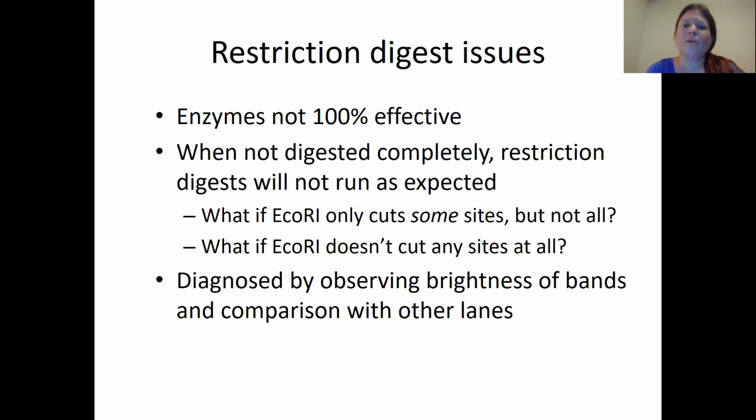There's another scenario, usually due to pipetting error. What if whichever enzyme it is didn't cut any sites at all? In both cases, you can figure out what's going on by looking at how bright the bands are and comparing them with other lanes. Hopefully you've seen that with a partial digest, you'll end up seeing a band higher up that's fainter than bands lower down, when a band that's higher up should actually be brighter. And the total size of the linearized plasmid can be confirmed by the other digest. Your TA will go over that exercise with you.